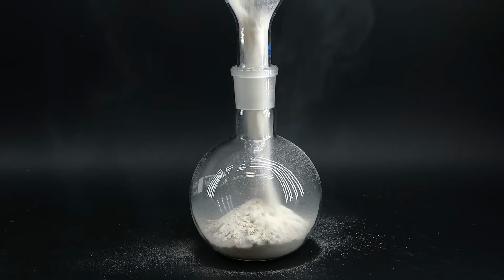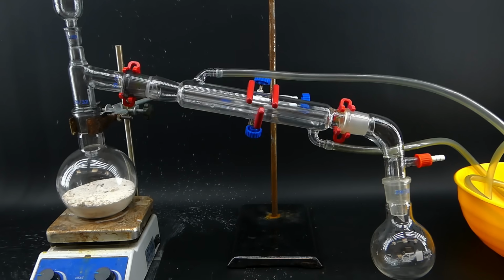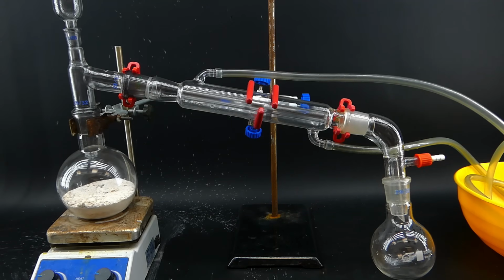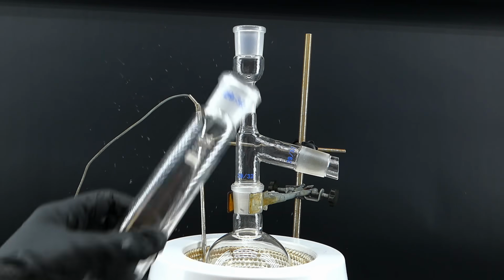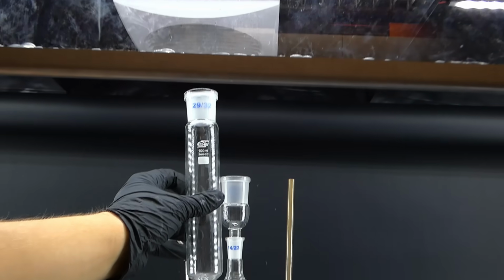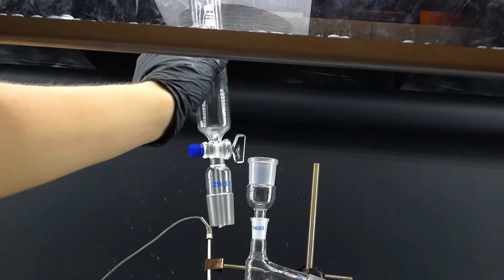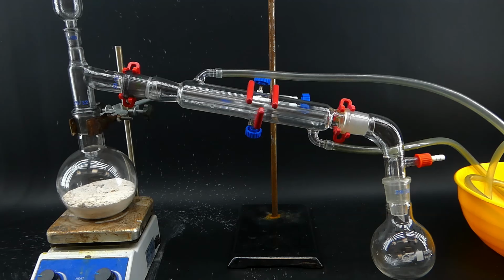Anyway, now I have to set up for the distillation, and to start, I filled a boiling flask with all of the sodium acetate that I made, and assembled a distillation apparatus. I firstly wanted to use a heating mantle, but it is too high for my new fume hood, and makes the dripping funnel impossible to properly position, and in this reaction it is absolutely necessary, and to install it, I just switched to my hot plate, which will hopefully get the job done just as well as the heating mantle.